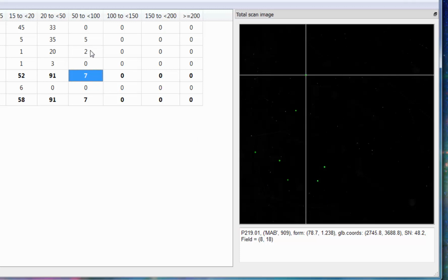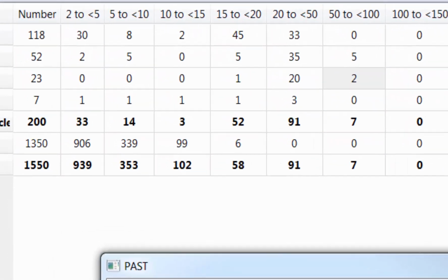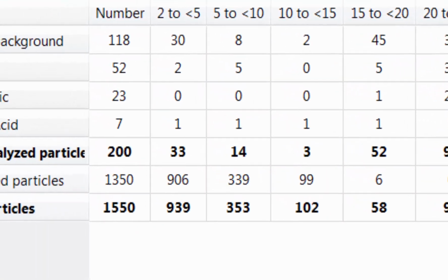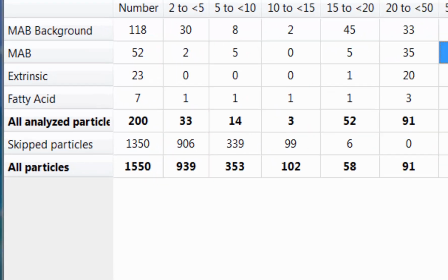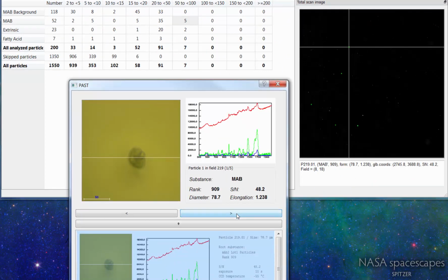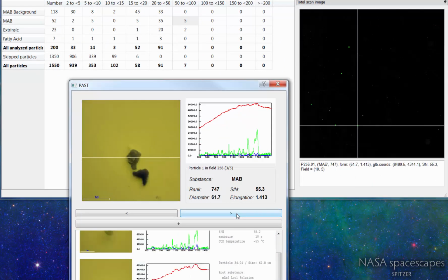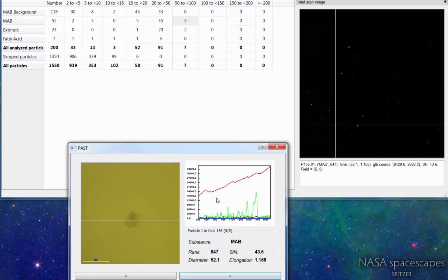2 of them were extrinsic materials, such as fibers or other types of materials. 5 of them were found as monoclonal antibodies. You see them here, those 5. We can go through them and take a look at those different particles.